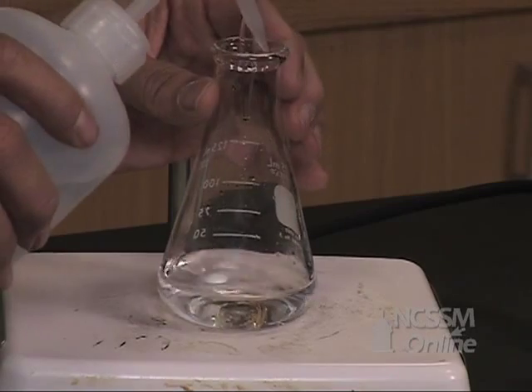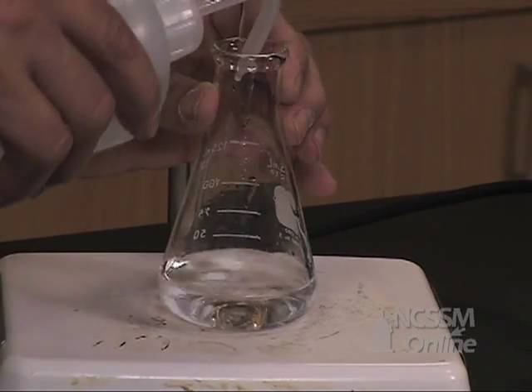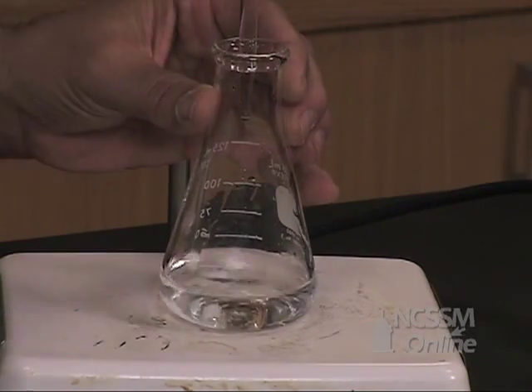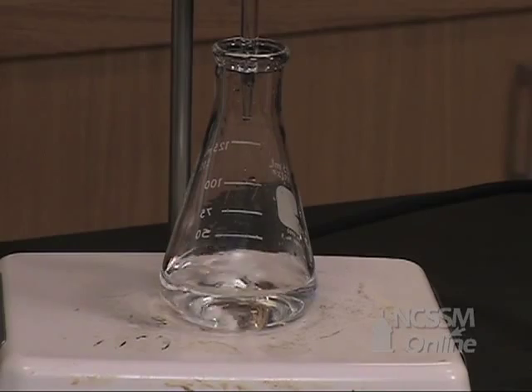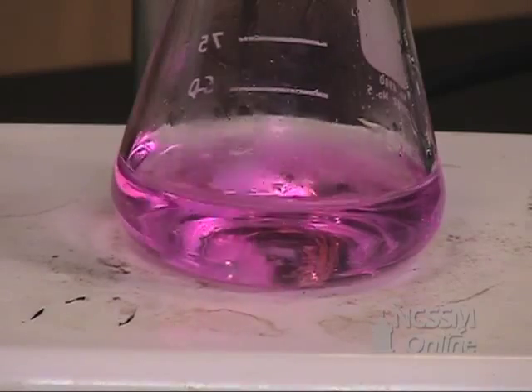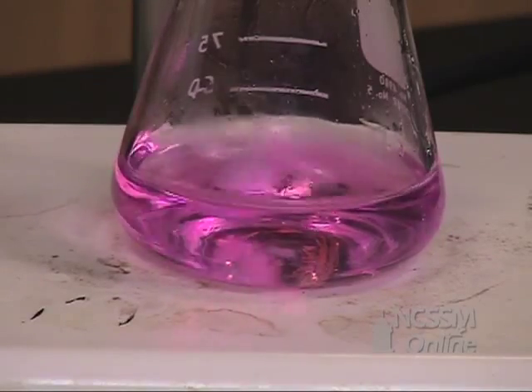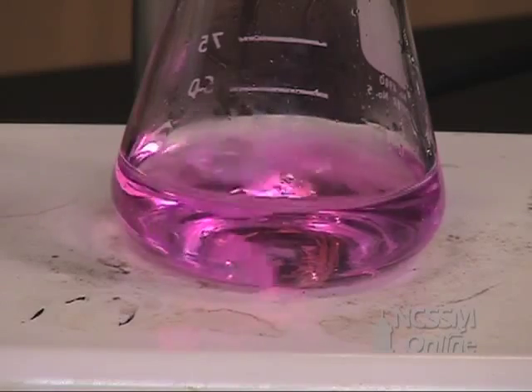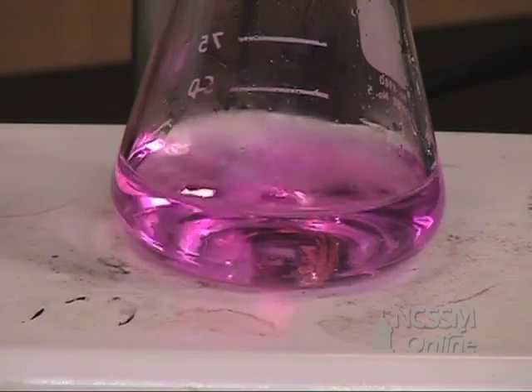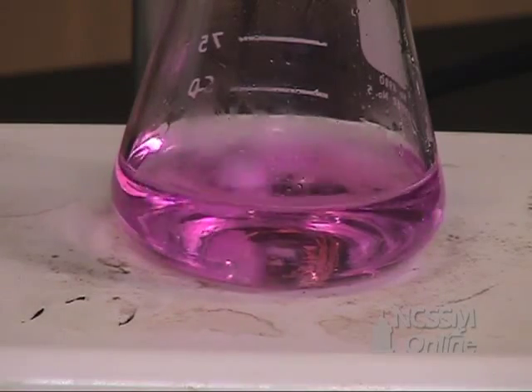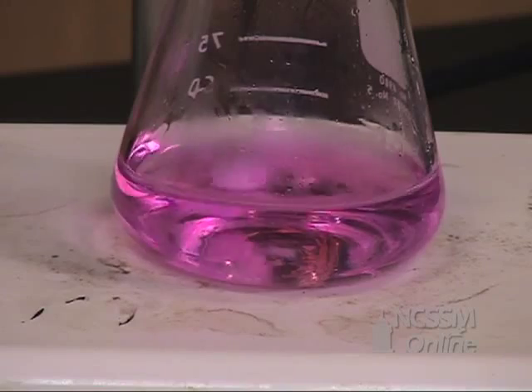During the titration, you should rinse down the walls of the flask to make sure that any material that is splattered on the sides of the flask gets a chance to react. When the solution has turned to pale pink color, you will take a final burette reading and you will calculate the total milliliters of NaOH solution used for the titration. You will titrate the other four vials in a similar manner.